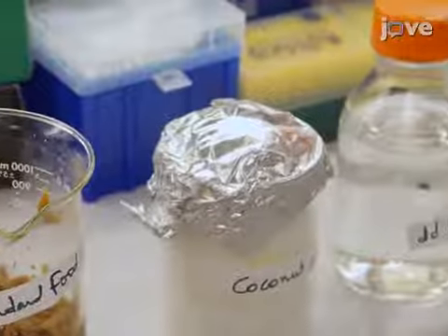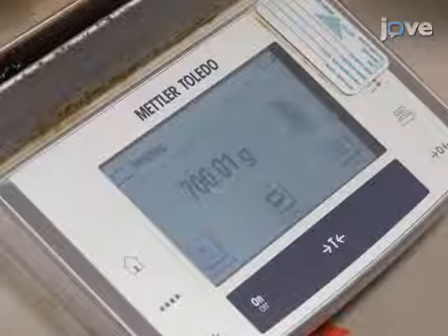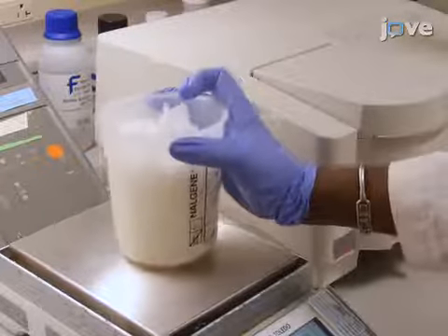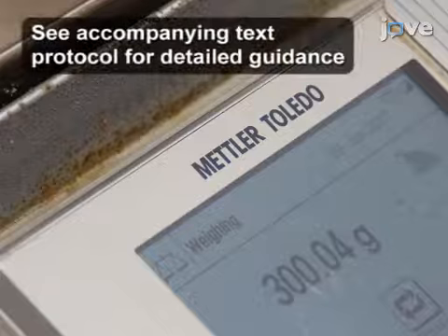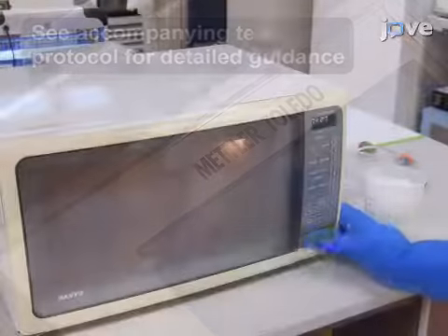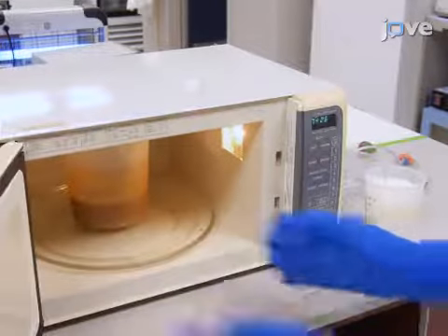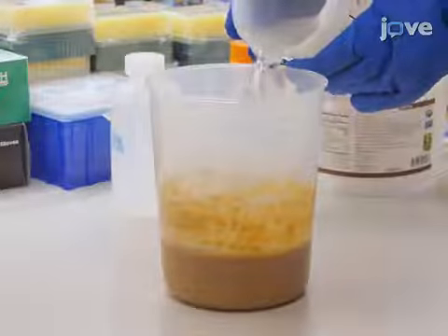To begin the experiment, prepare one kilogram of high-fat food. Weigh 700 grams of pre-made fly food and 300 grams of coconut oil into two separate containers using an analytical balance. Heat each container individually in the microwave until the contents melt completely. Pour the melted coconut oil into the fly food container and stir the contents using a whisk until the oil is mixed into the fly food.